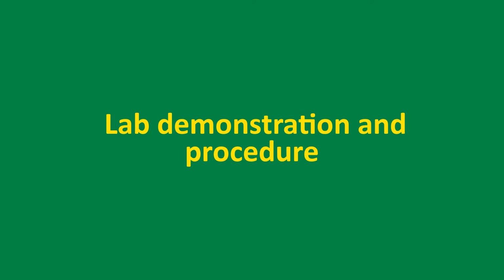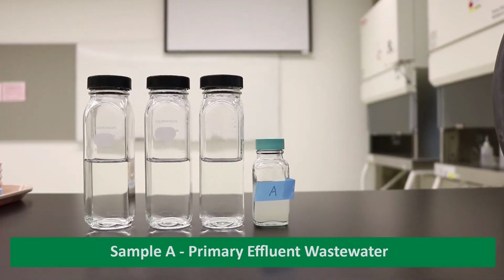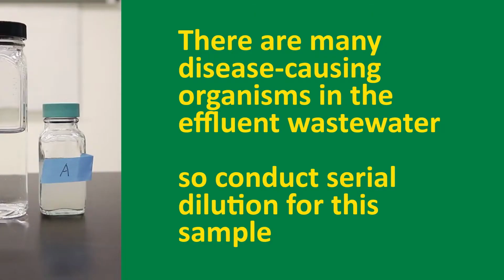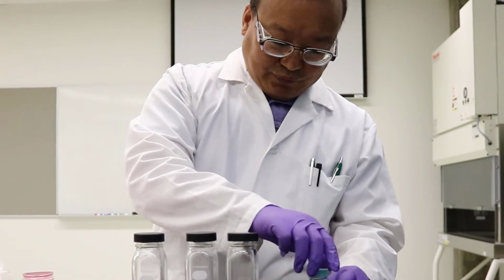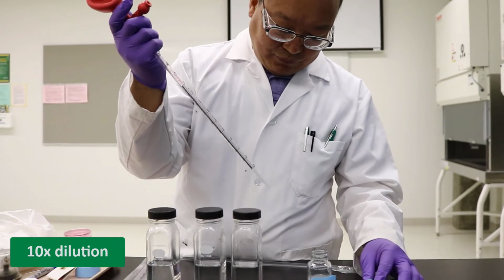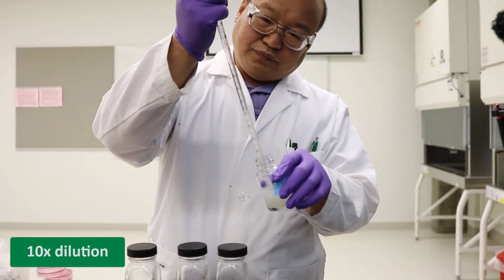First, we will complete the serial dilutions. We have 2 samples, primary effluent wastewater, labeled as sample A, and river water, labeled as sample B. We know there are many disease-causing organisms in the effluent wastewater, so we conduct serial dilution for this sample. Mix sample A well, then take 10 ml sample, transfer it into a bottle with 90 ml of dilution solution and mix it. This is the 10 times dilution sample.